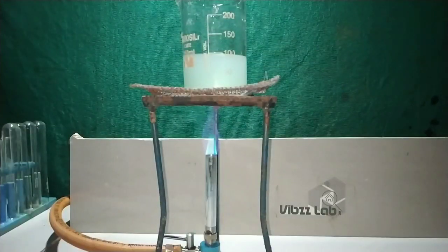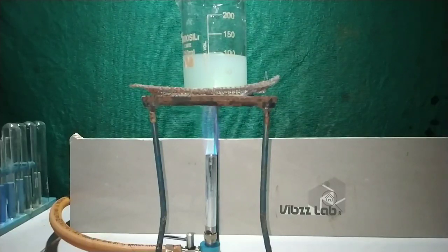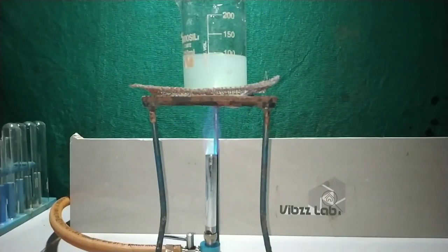After all the metal has reacted, I will now boil off the excess water and then try to recrystallize the salt from its solution.